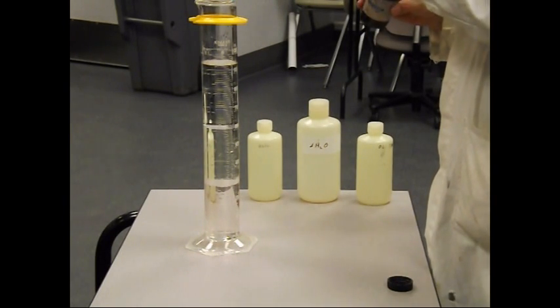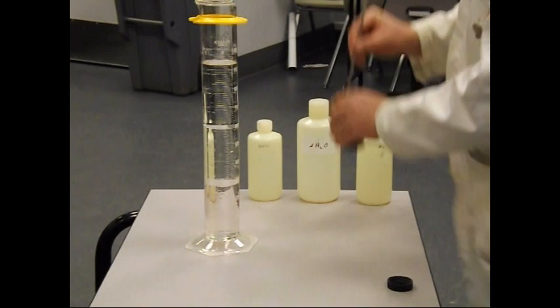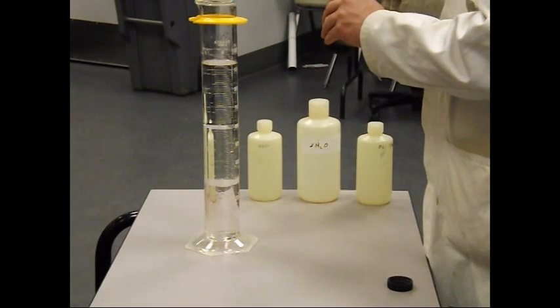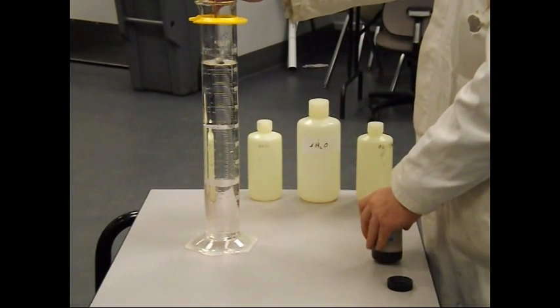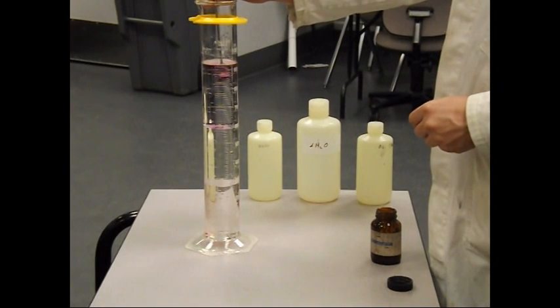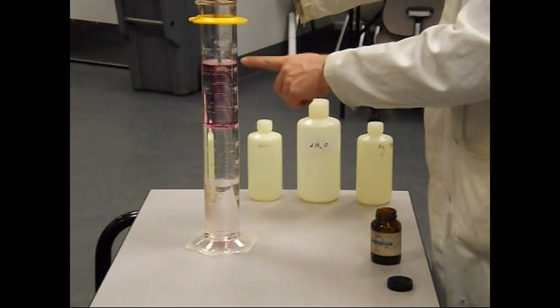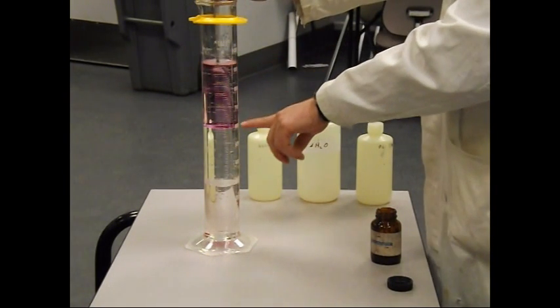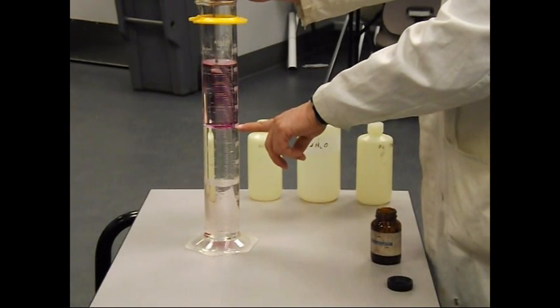So we're going to take a tiny amount of iodine and just let it sit here. It's going to take a little bit to dissolve. Actually, the crystals that are coming off are slowly dissolving into hexane, but they're actually sitting at the water-hexane interface.